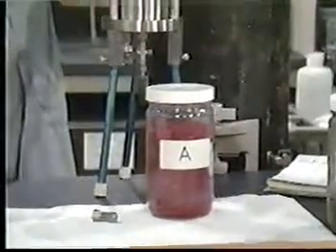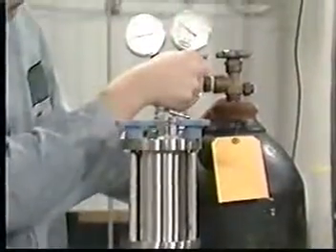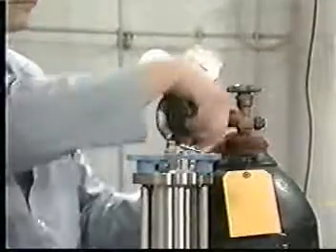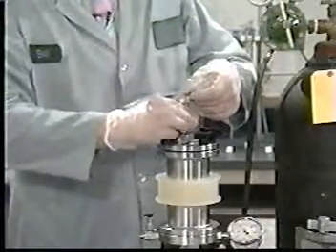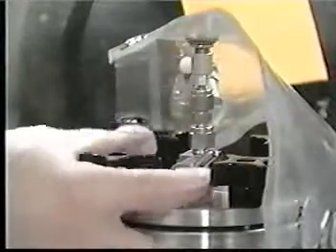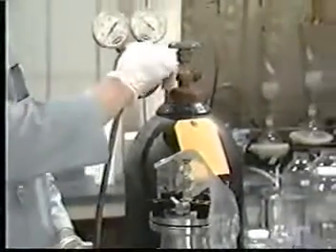Wastes such as A, composed of 100% solids, do not require initial filtration. In these instances, slowly increase the pressure to 50 psi, then proceed to the addition of extraction fluid. For waste containing free liquids, initial filtration is a necessary step. Attach the pre-evacuated collection container to the liquid inlet-outlet valve. Open the valve and slowly apply 1 to 10 psi to force liquid out of the ZHE.